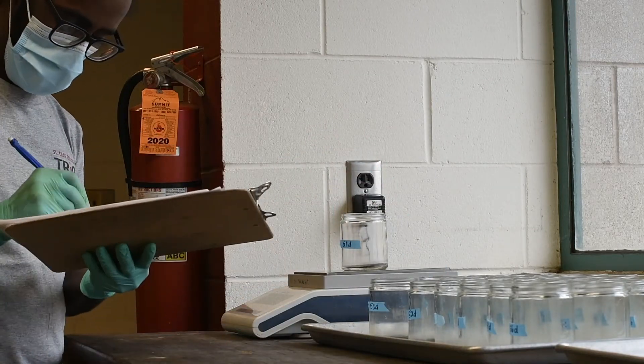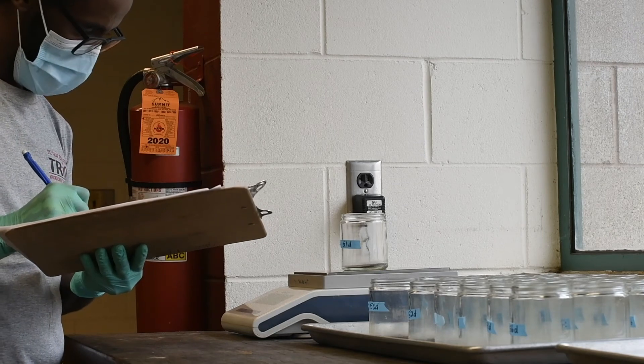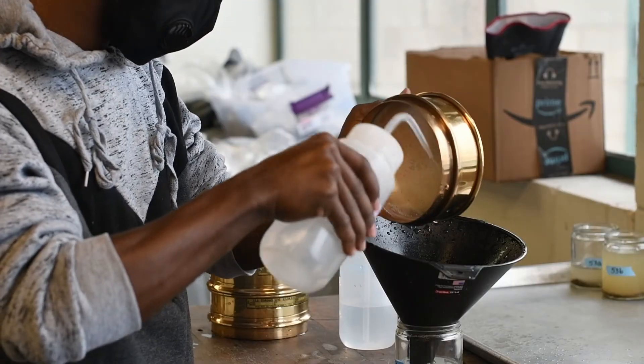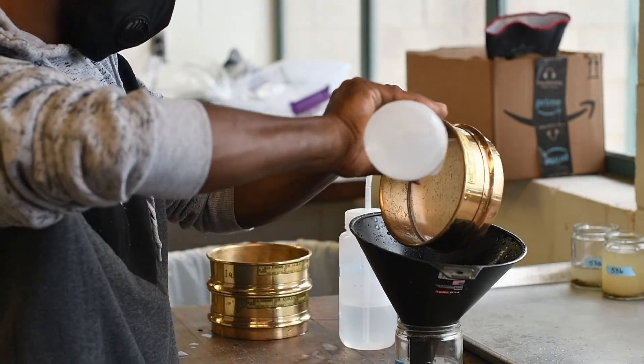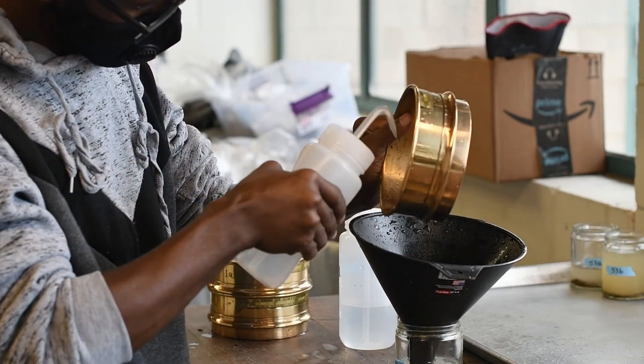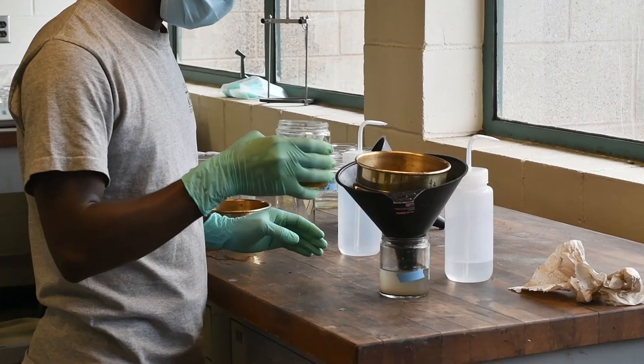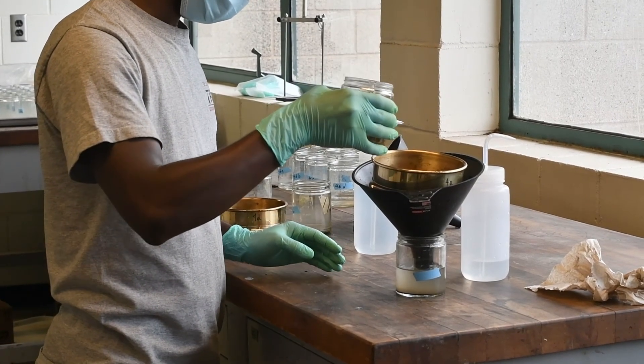Your next task is to correct each aggregate fraction for sand and gravel. That is, we need to distinguish between what is an actual aggregate and what is a mineral particle that is simply too large to fit through the sieve, which we generally refer to as sand and gravel.